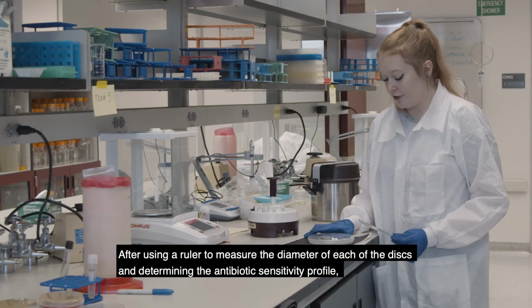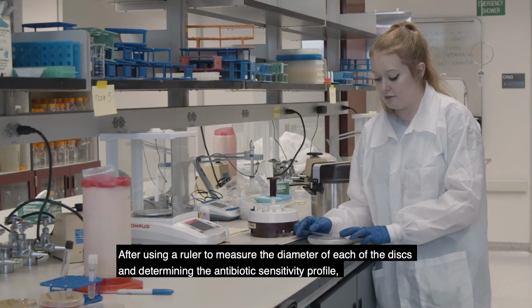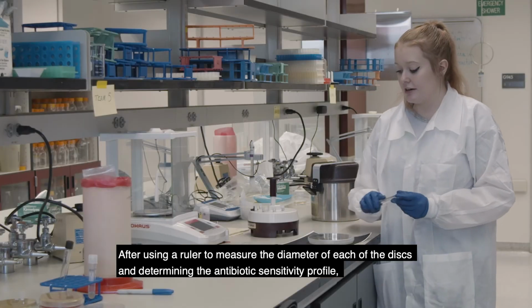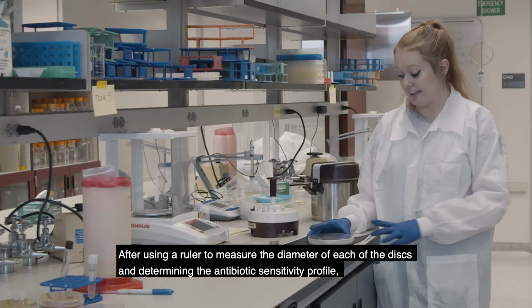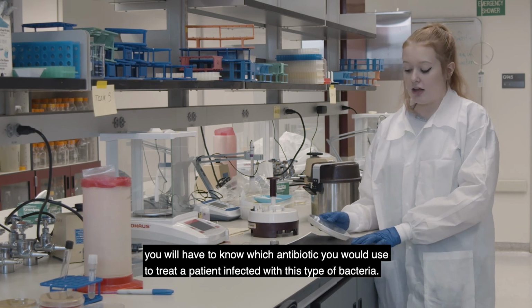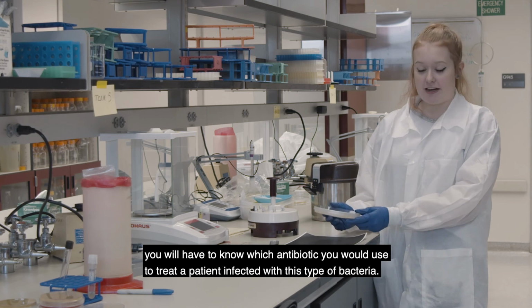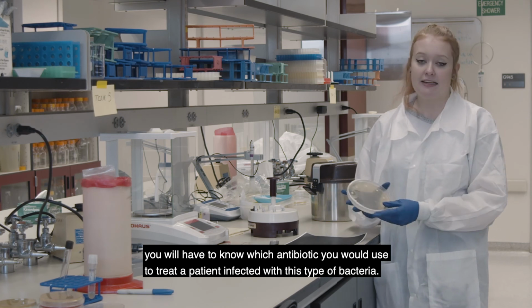So after using a ruler to measure the diameter of each of the discs and determining the antibiotic sensitivity profile, you will have to know which antibiotic you would use to treat a patient who was infected with this type of bacteria.